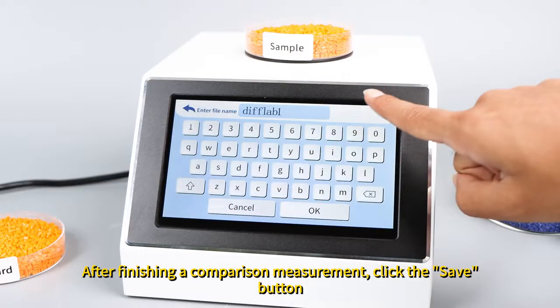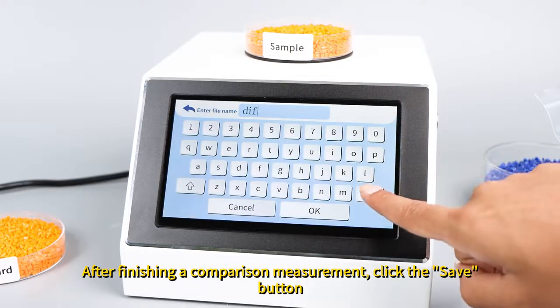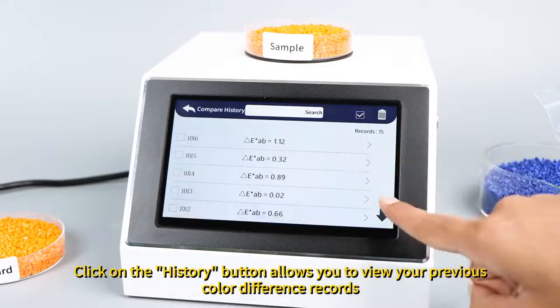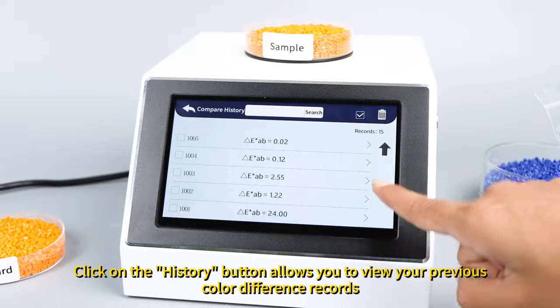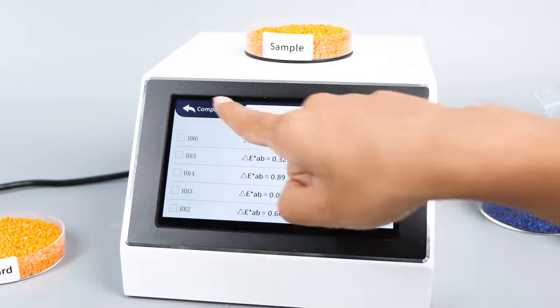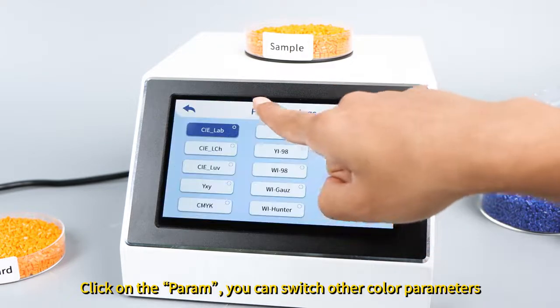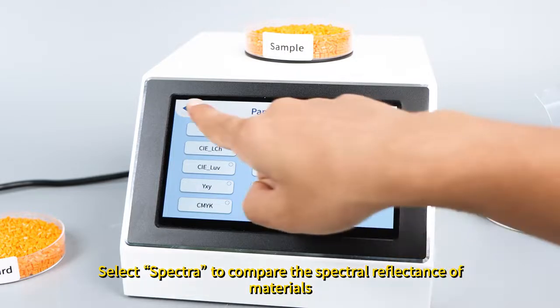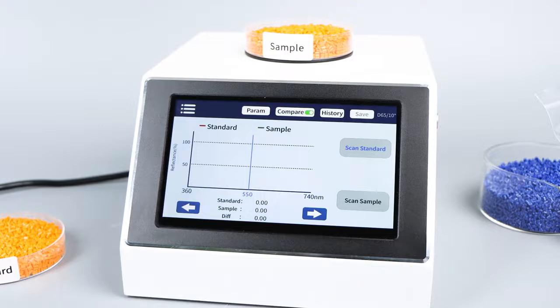After finishing a comparison measurement, click the Save button. You can save the color difference comparison data. Clicking on the History button allows you to view your previous color difference records. Click on the param, you can switch other color parameters. Select Spectra to compare the spectral reflectance of materials.